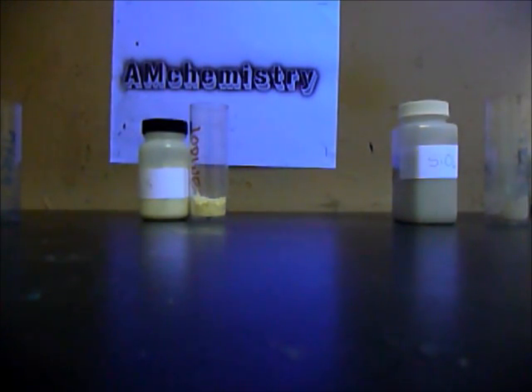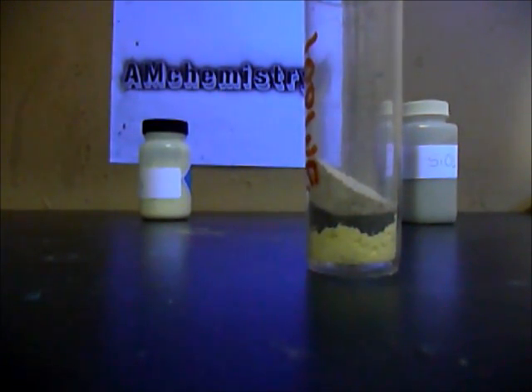Now the chemicals are ready to be mixed together. I'll grab a beaker or a mini pot like this, and put the aluminum powder, the sulfur, and the silicon sand in. Just mix really thoroughly and you will see a color change. I'll show you when this is ready.